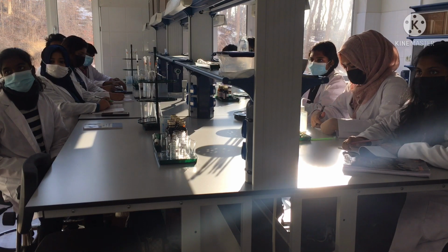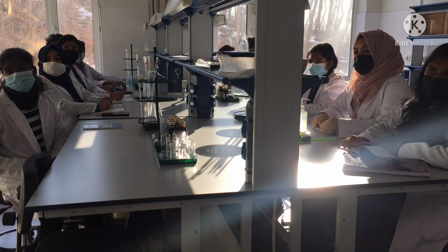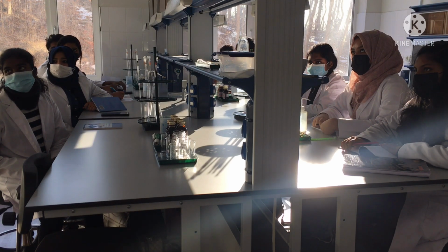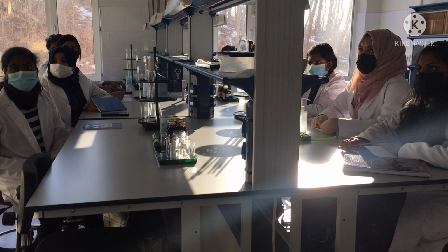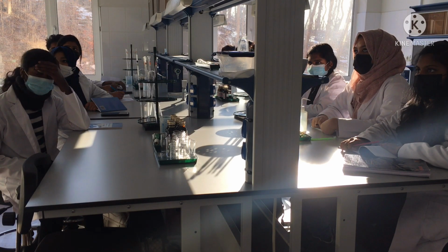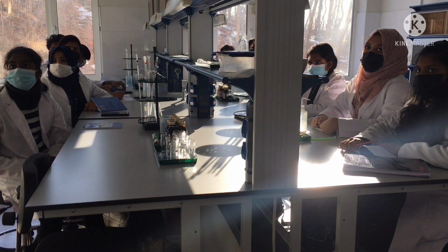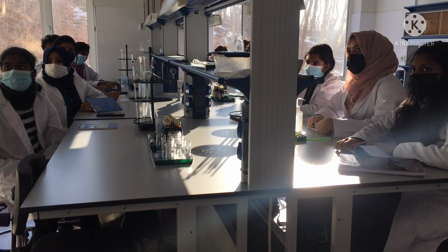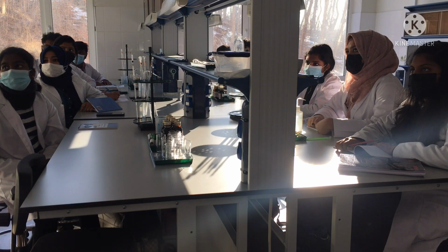In this reaction, we will study the speed of the reaction affected by different terms. Today we will have 3 series of experiments. In the first series, we will study the influence of different amounts of components. We will have some first components and a final component that we will add at the end of the reaction, and we will see the change of color. That means that the reaction is finished. We will try to measure the time needed to finish the reaction.